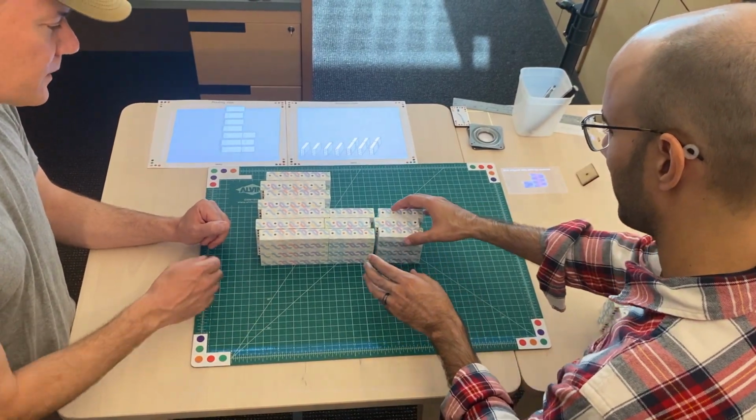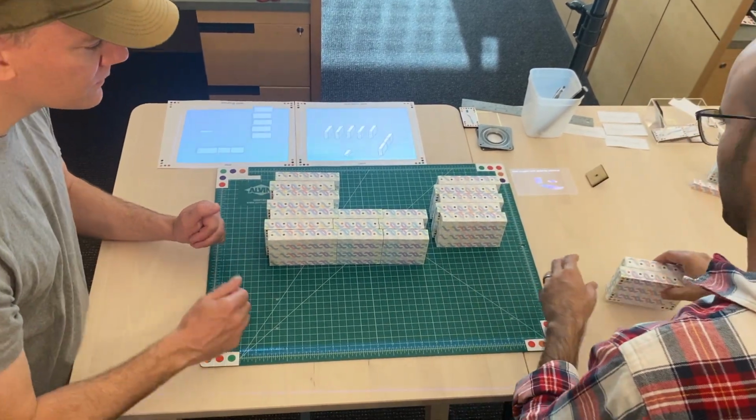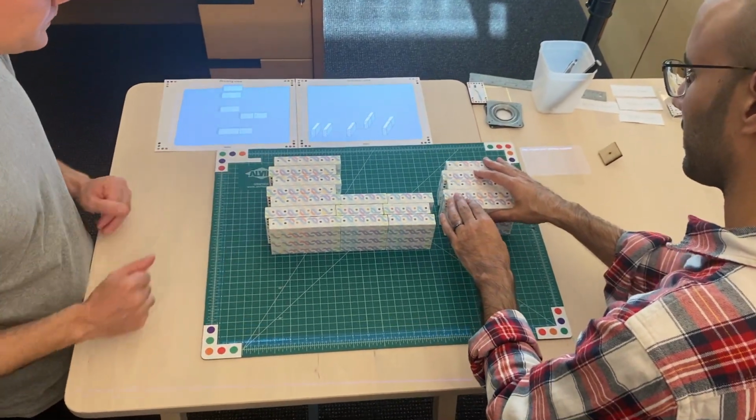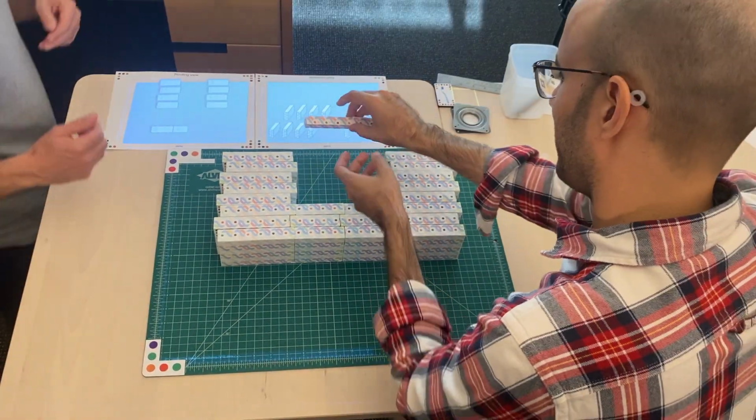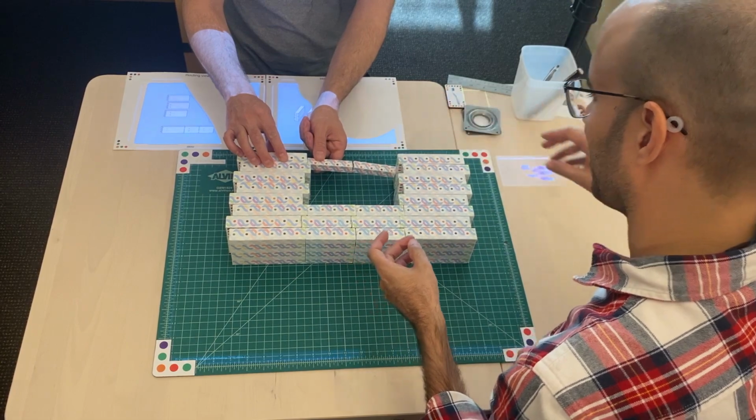Here we're assembling blocks on the table into a 3-dimensional scale model of the nanostructure. As we build the model, we see the routing diagrams above fill in with an auto-routed scaffold strand. Here we're putting in the blocks for the single helix stage that the proteins will bind to.